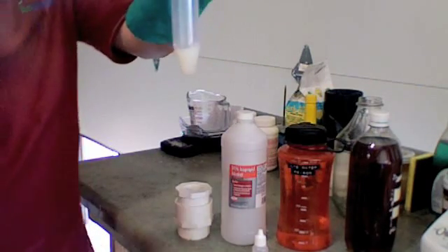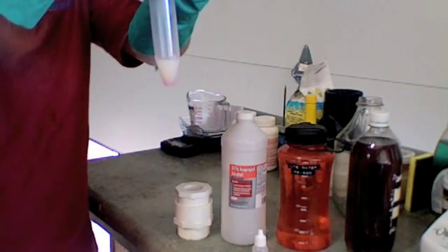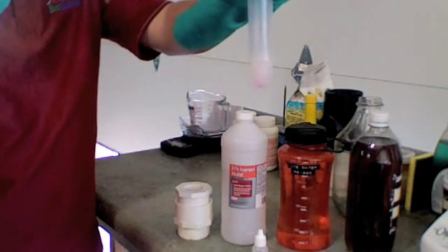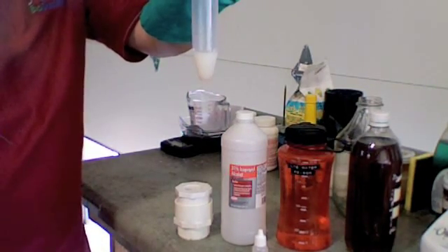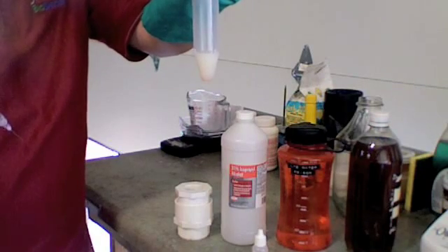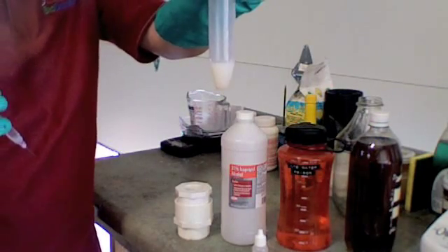Some pink but it goes away. One point five. Pink and it goes away a little slower. The closer you get to the right titration number, the longer the pink will stay. We need to stay for thirty seconds.